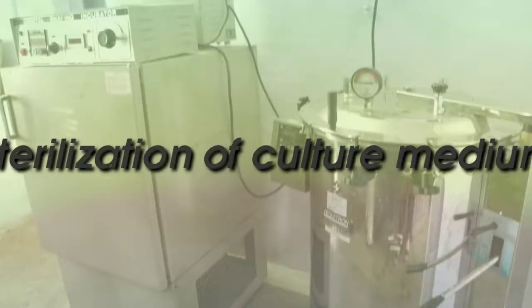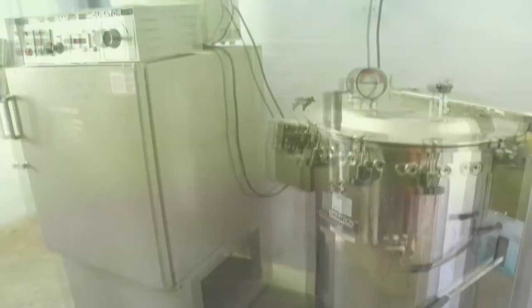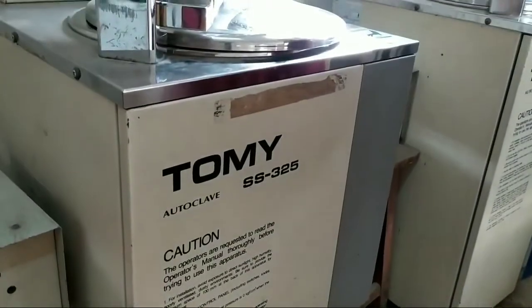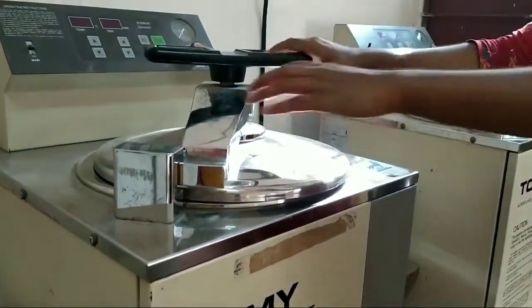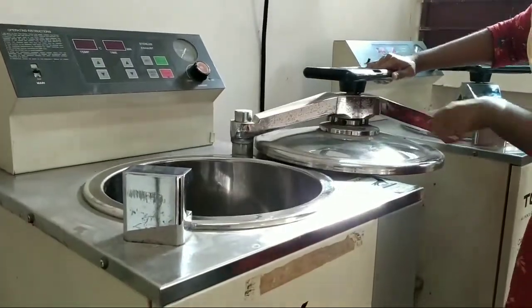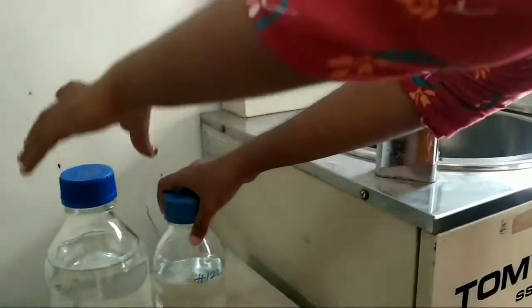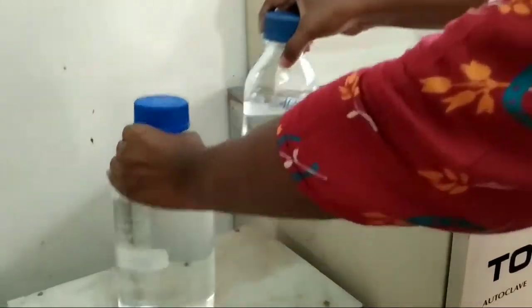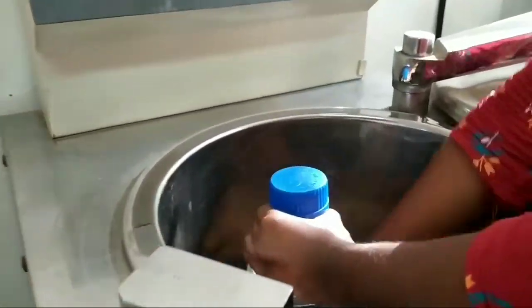The next step is the sterilization of culture medium. After adjusting the pH to 5.8, the culture tubes were plugged with non-absorbent cotton, wrapped in cheesecloth, and autoclaved at 1.06 kg per cm² and 121 degrees Celsius for 15 minutes.